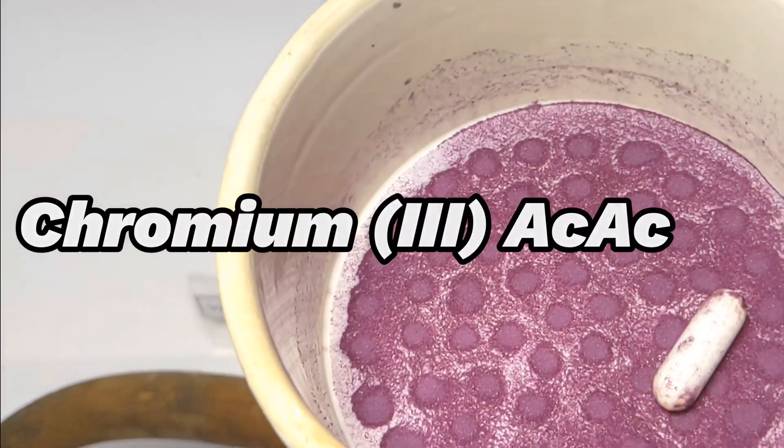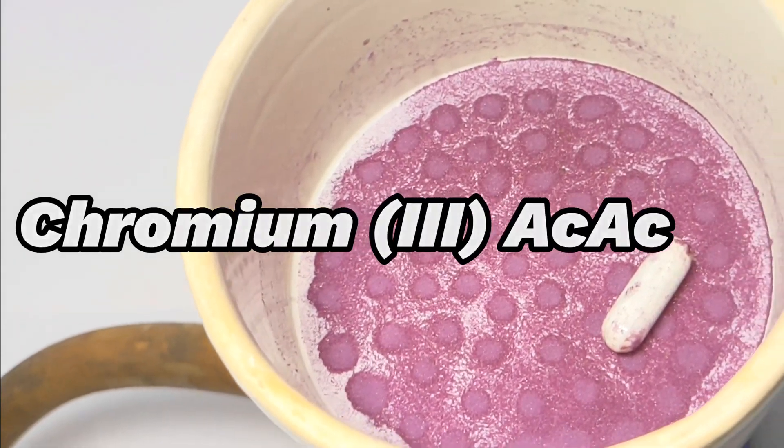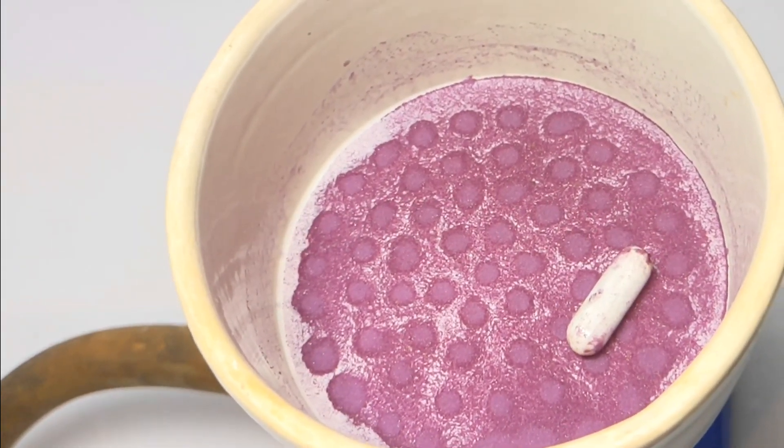Hello friends, in this video we will prepare chromium acetylacetonate from chromium III chloride and acetylacetone.